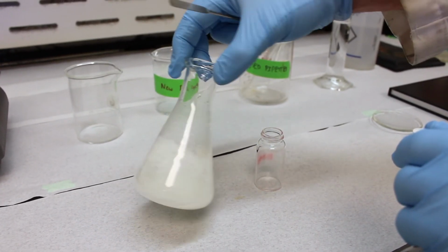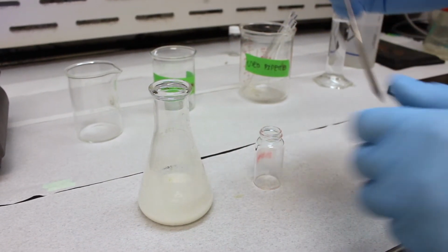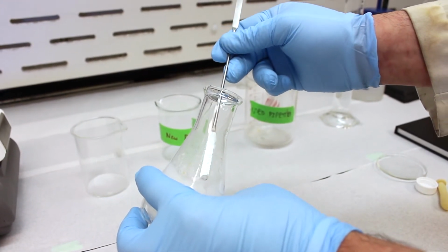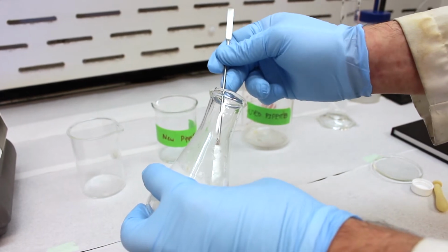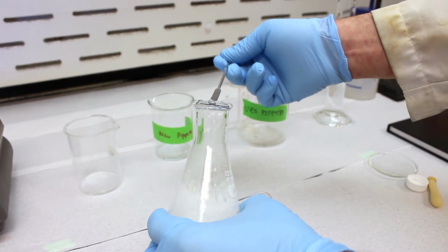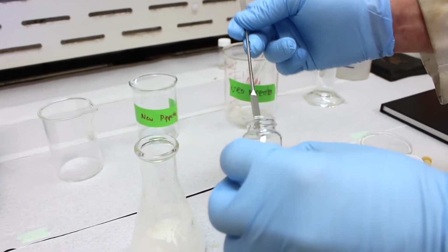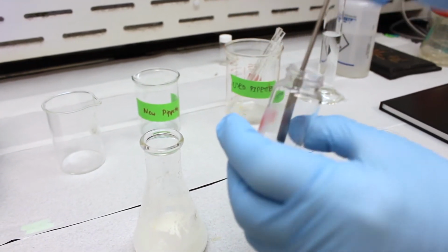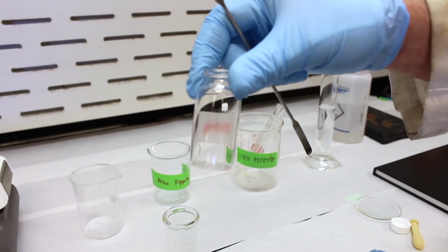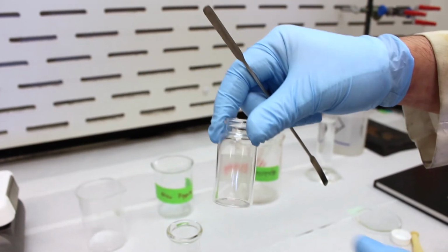So to compare and contrast the non-recrystallized product and the crystallized product, how pure they are, we're going to take a small sample of these crystals. So I'm just going to take a spatula and maybe grab some off the edge. Oops, it's a little challenging. And I'm going to place some in a vial to save for later. You can see we've got a little sample in there. This is the non-recrystallized product. So we're going to compare the melting point of this to the melting point of the recrystallized product, which we're going to make right now.